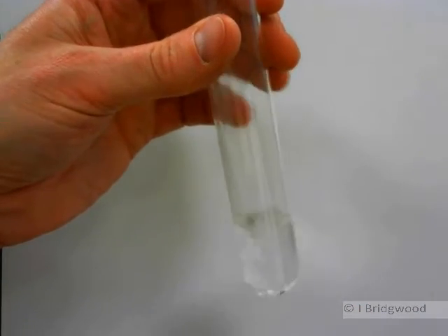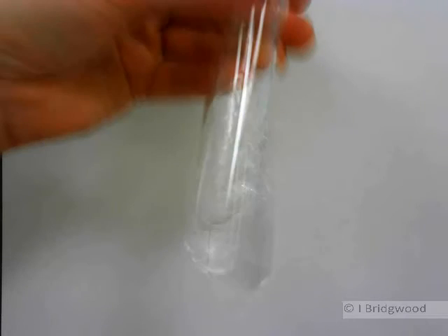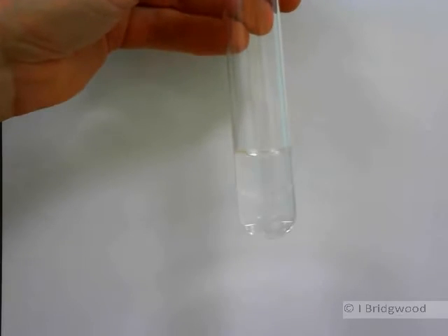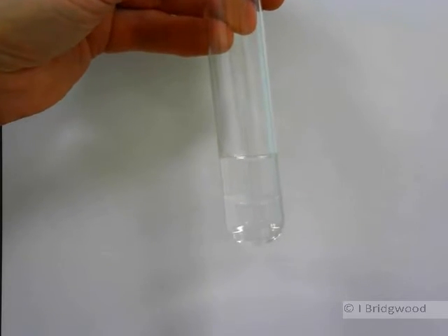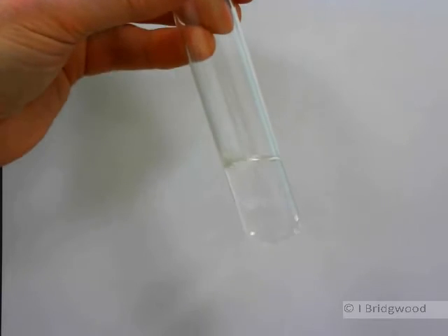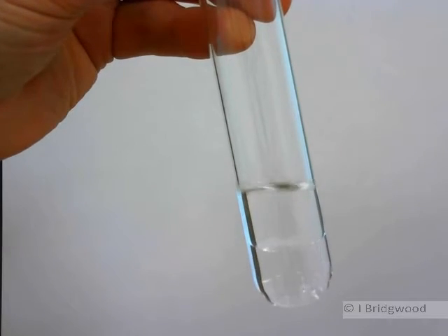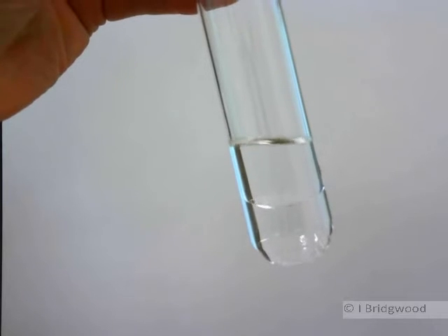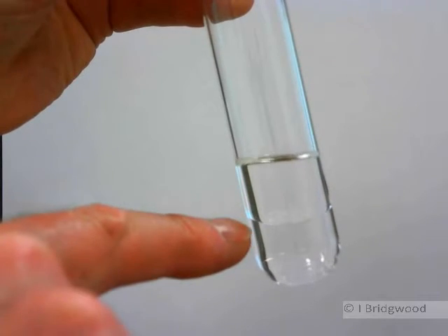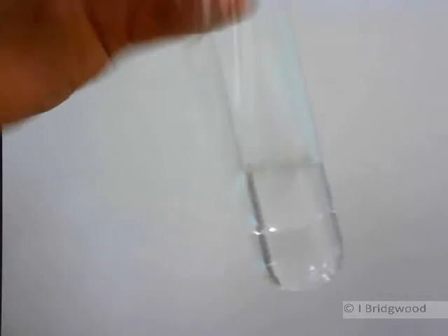So let's just see what happens when we mix the two. Give it a bit of a shake. And I think you can see, not particularly easily, let's put it a bit closer, there you go. You may well be able to see that there are two layers there. So it's not dissolving.